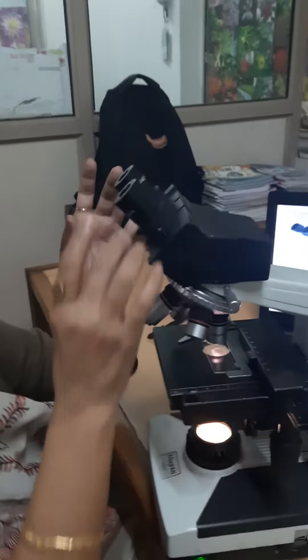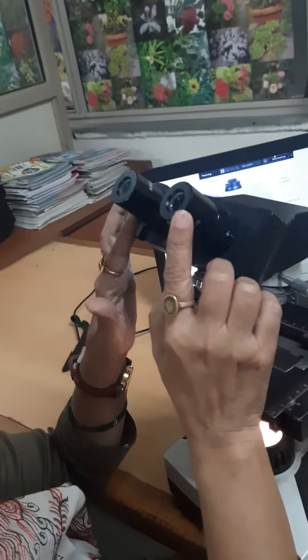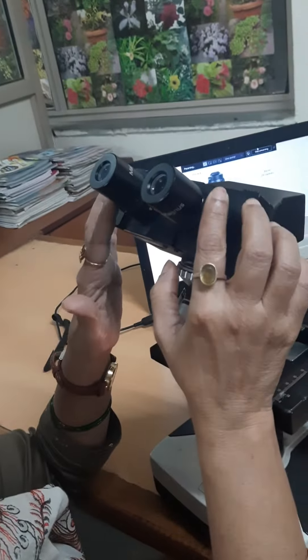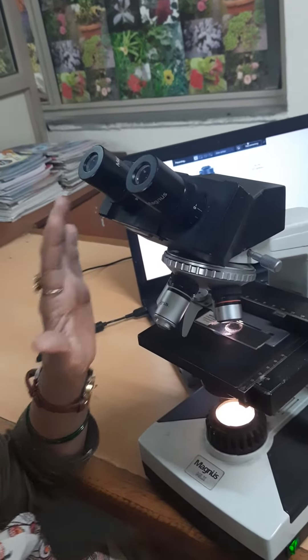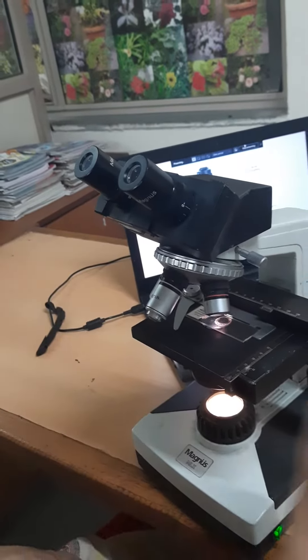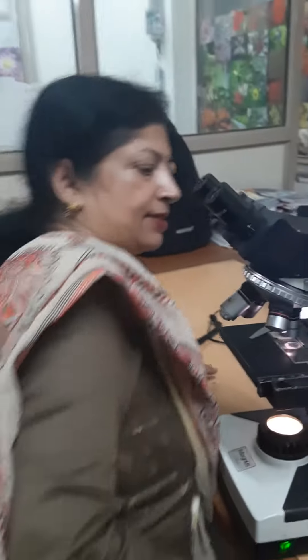We can view the specimen through this lens — this is known as the ocular lens or the eyepiece. Its power is 10x.